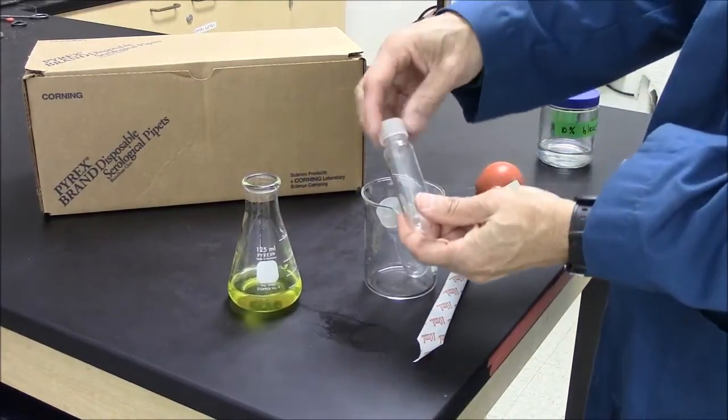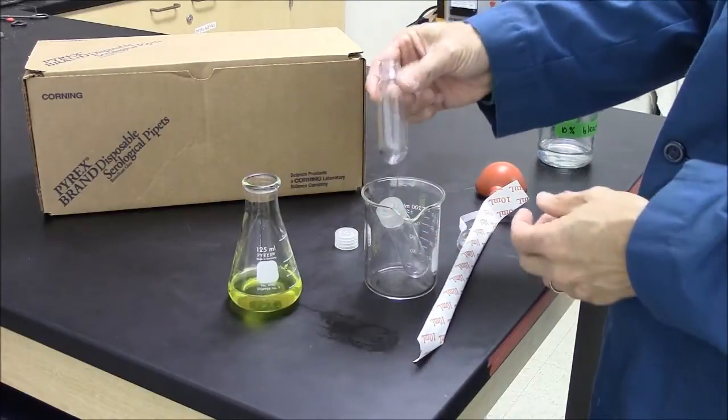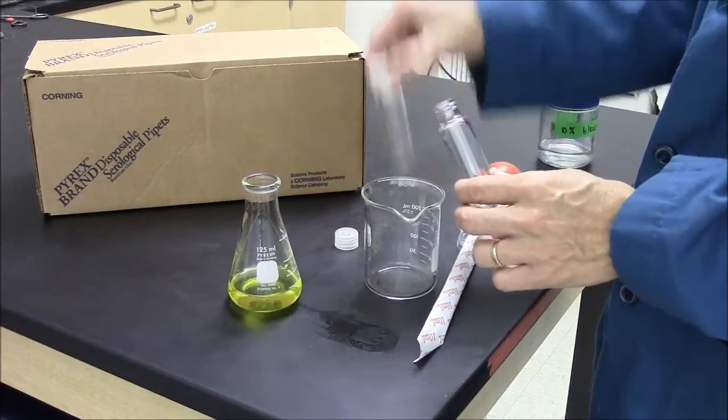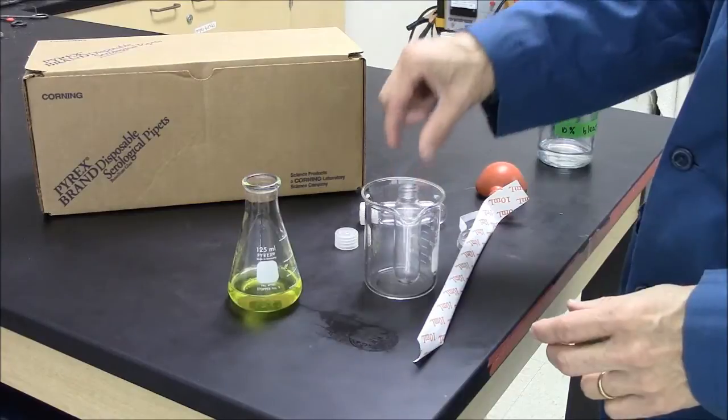I'm trying to transfer that bacterial solution into a centrifuge tube. These are polycarbonate. I'm using a beaker to support the tube.